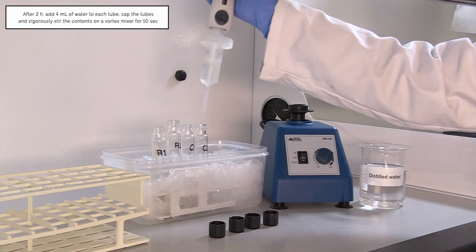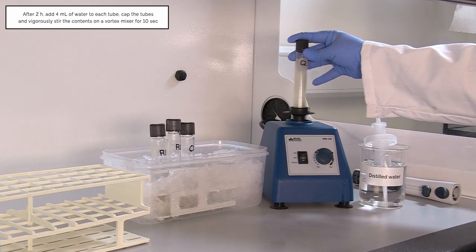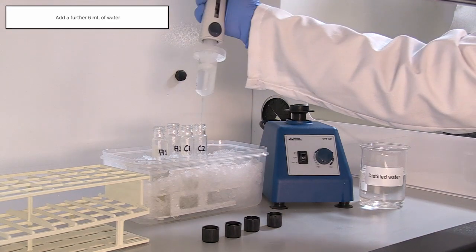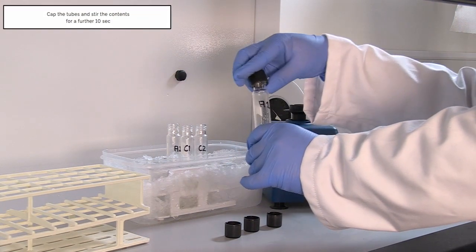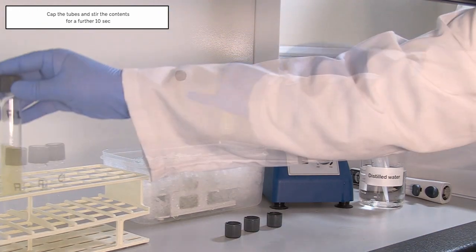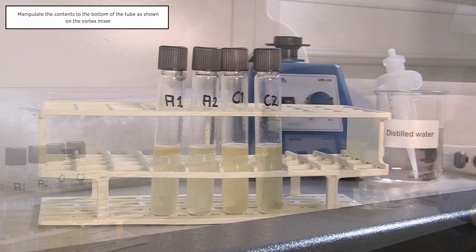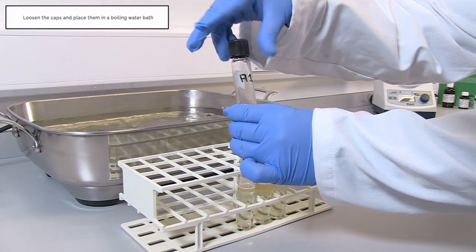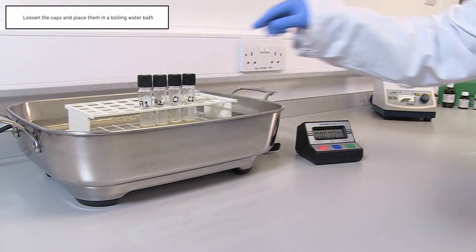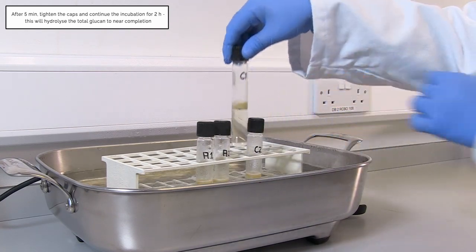After 2 hours, add 4 milliliters of water to each tube. Cap the tubes and vigorously stir the contents on a vortex mixer for 10 seconds. Then add a further 6 milliliters of distilled water, cap and stir for a further 10 seconds. Manipulate the contents to the bottom of the tube on the vortex mixer. Loosen the caps and place the tubes in a boiling water bath. After 5 minutes, tighten the caps and continue the incubation for 2 hours — this will hydrolyze the total glucan to near completion.